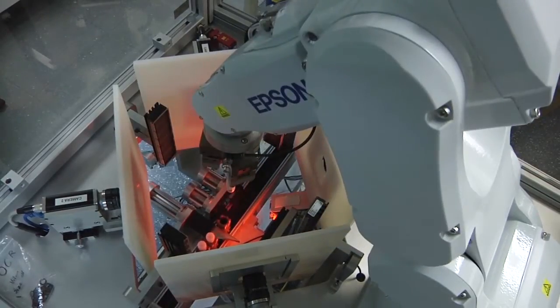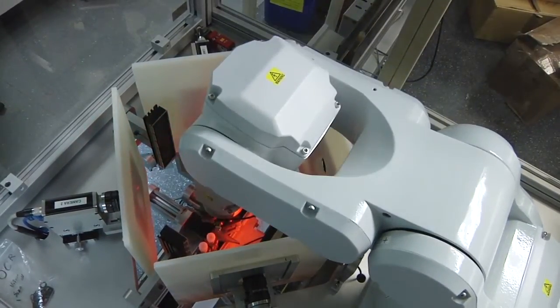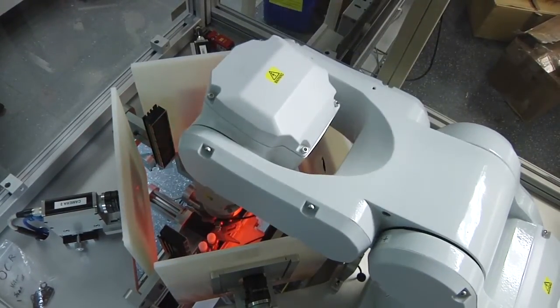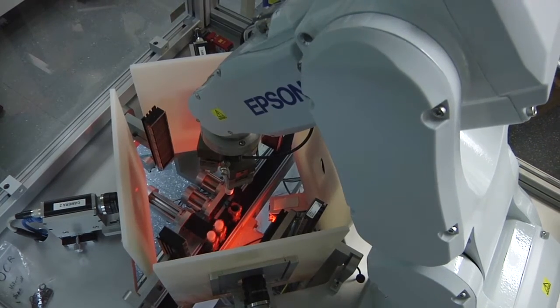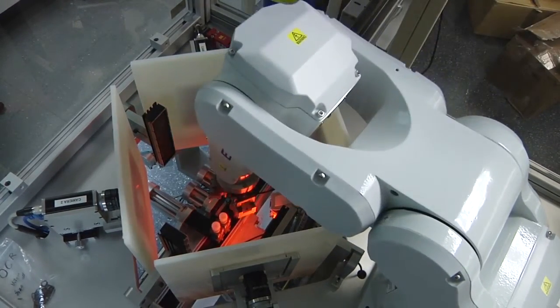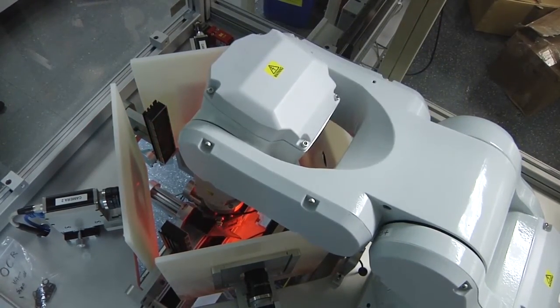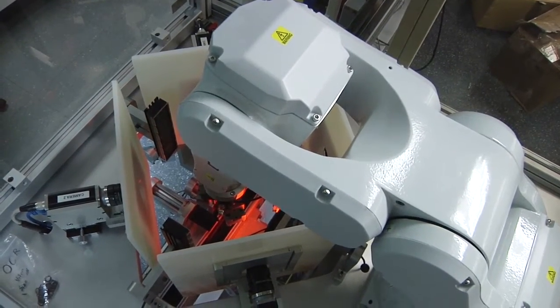This view from the top shows the robot and vision system. There are four equally spaced cameras with four reflective panels and four strobe lights. As you can see from this pause in the video, the strobe lights are very bright. The vision system software precisely stitches the four separate photographs into a single photograph, which is the entire exterior of the tube and is so sharp that OCR can be performed.